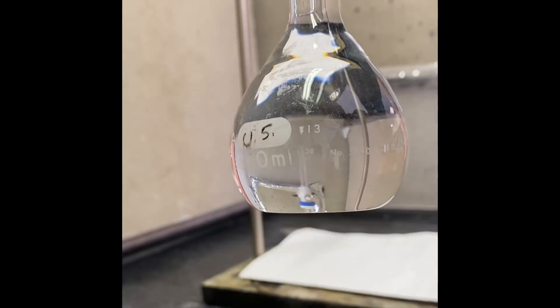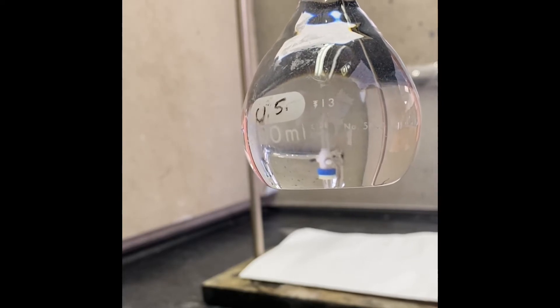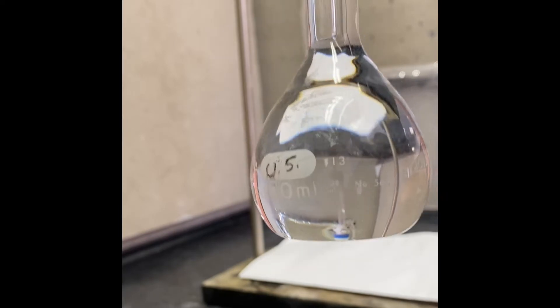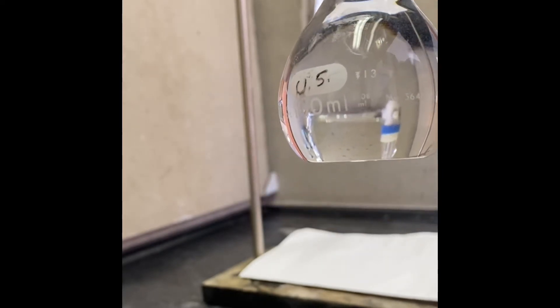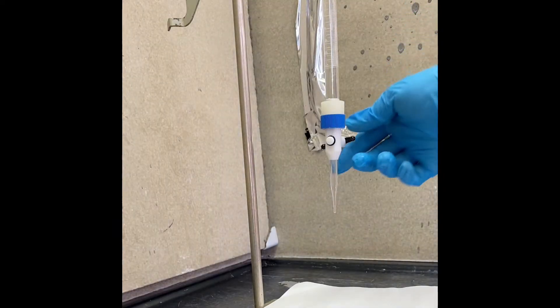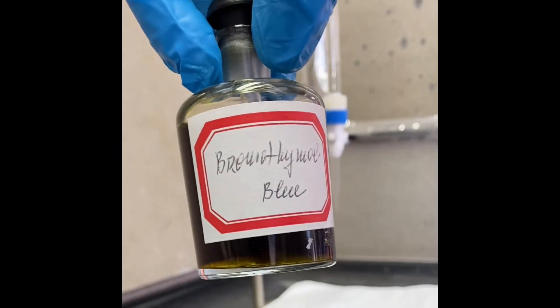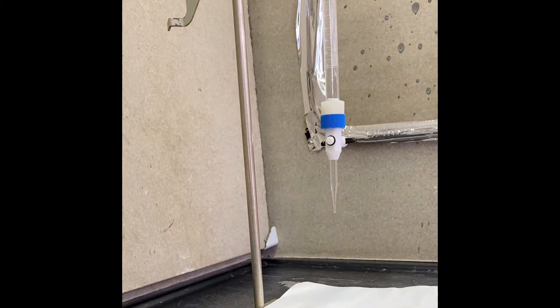For this reaction we're using one gram of tert-butyl chloride in 100 milliliters of 50/50 isopropanol and water solution. In the burette I have sodium hydroxide standardized at 0.0398 molar. As mentioned in our handout, after 10 minutes we're going to do titration with sodium hydroxide.